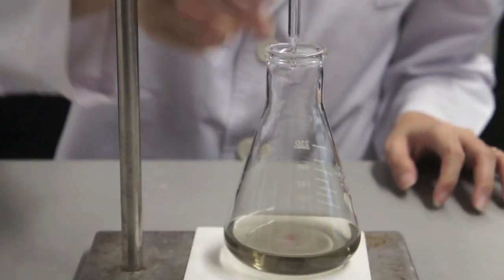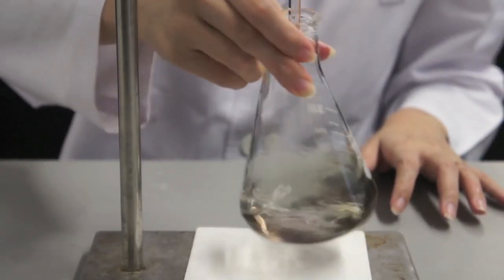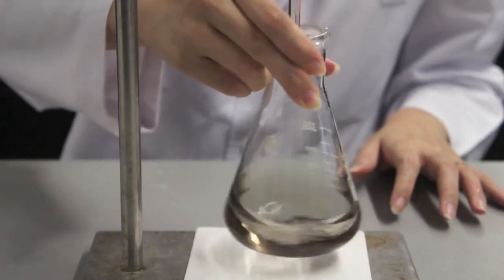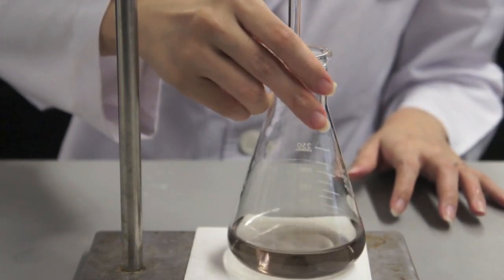Add another drop to see if the solution remains grey or if hints of purple start to appear in the indicator. If it does, as in this case, use the previous reading as your final reading.